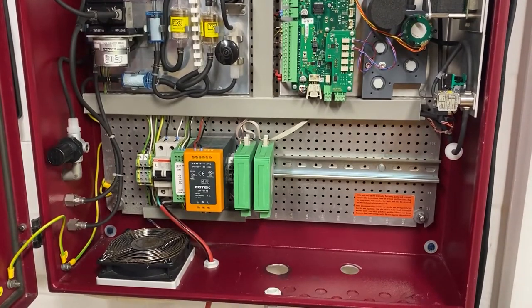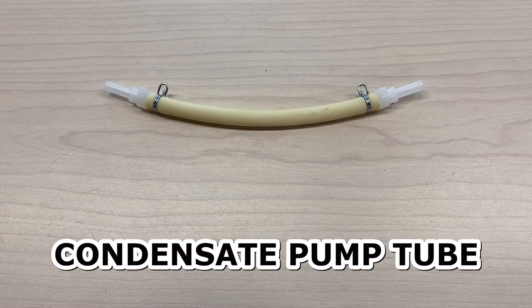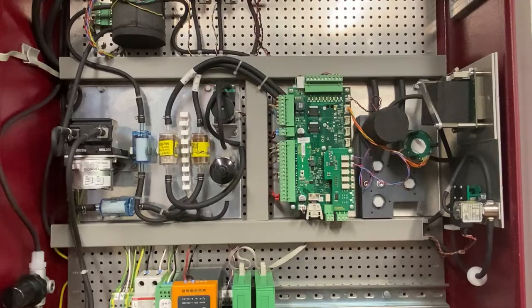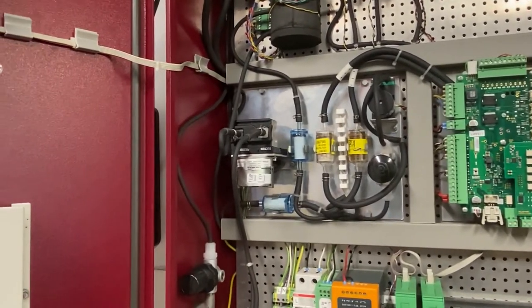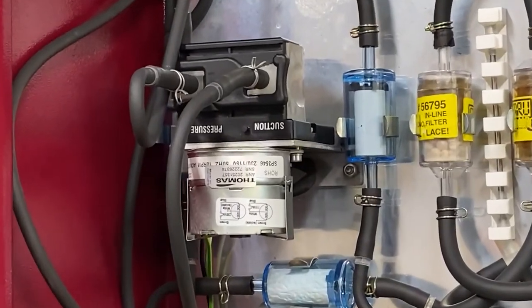Here we'll be going over replacement of the condensate pump tube. It can be found inside the condensate pump to the far left inside the SWG 100.